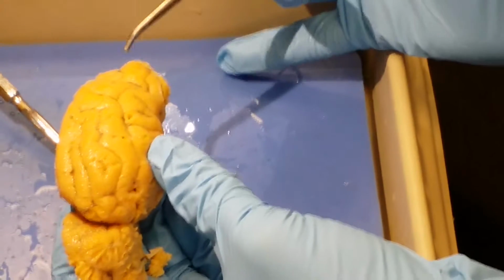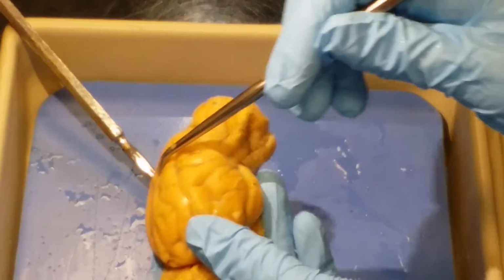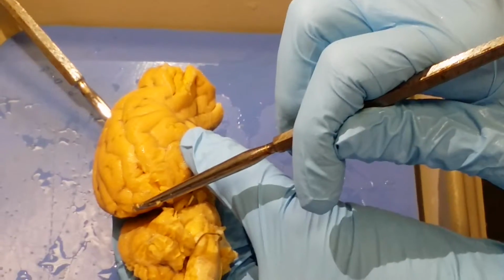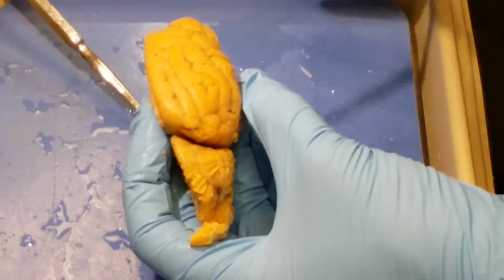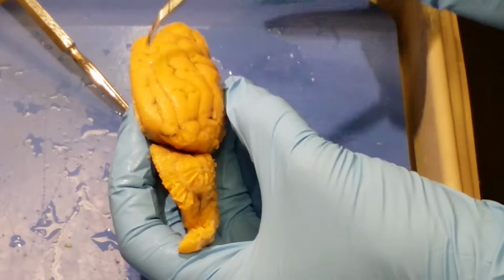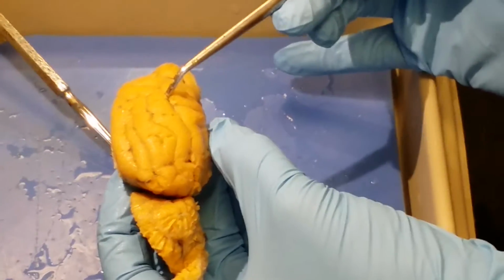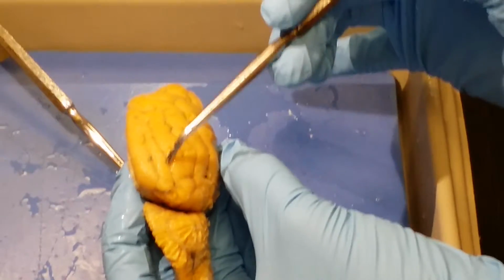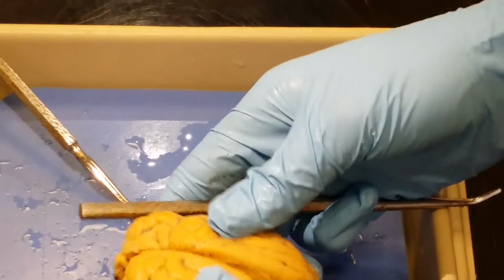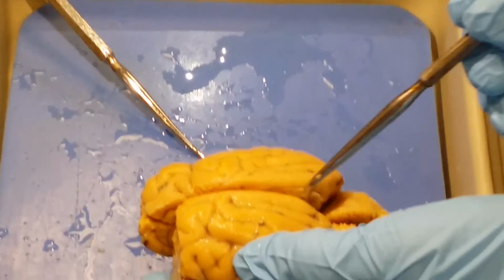So we've got the frontal lobe, the parietal lobes, the temporal lobe, and the occipital lobe. Gyri and sulci: gyri are any bump or hill, right? All of these are gyrus. Sulci are any of the grooves, so any of the lines you see, that's a sulcus, that's a sulcus, that's a sulcus. Longitudinal fissure would be if we were to put them together, right? The longitudinal fissure goes straight down the middle.